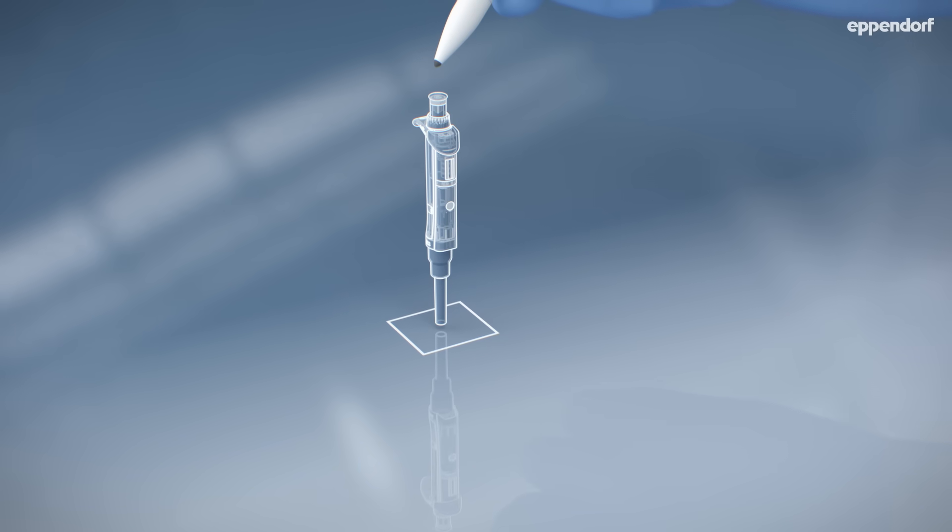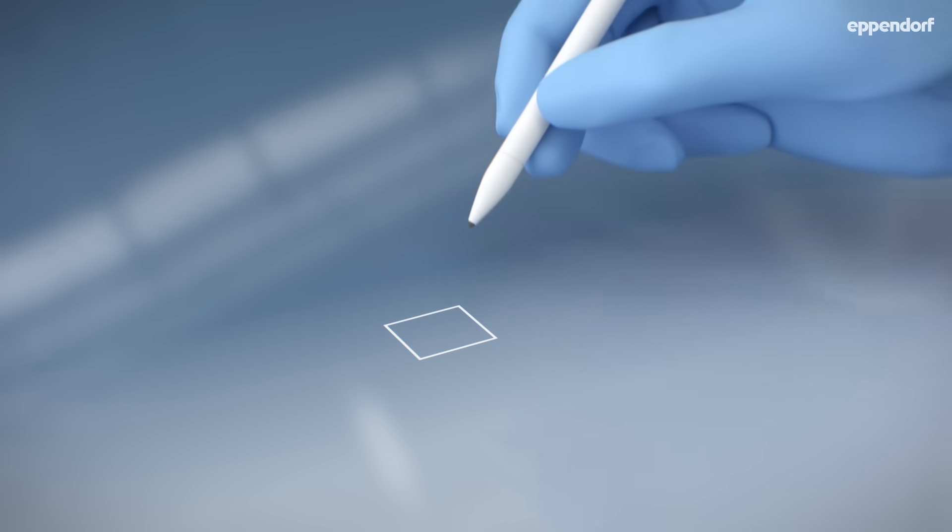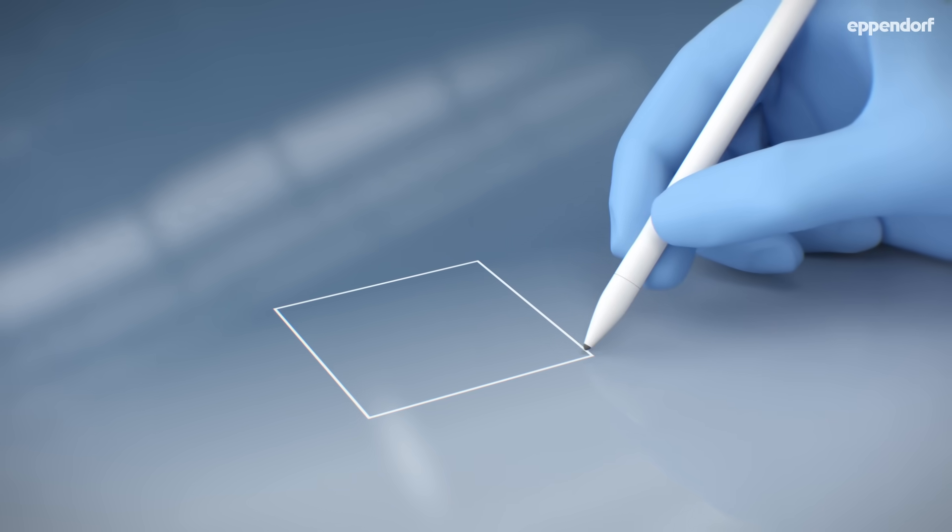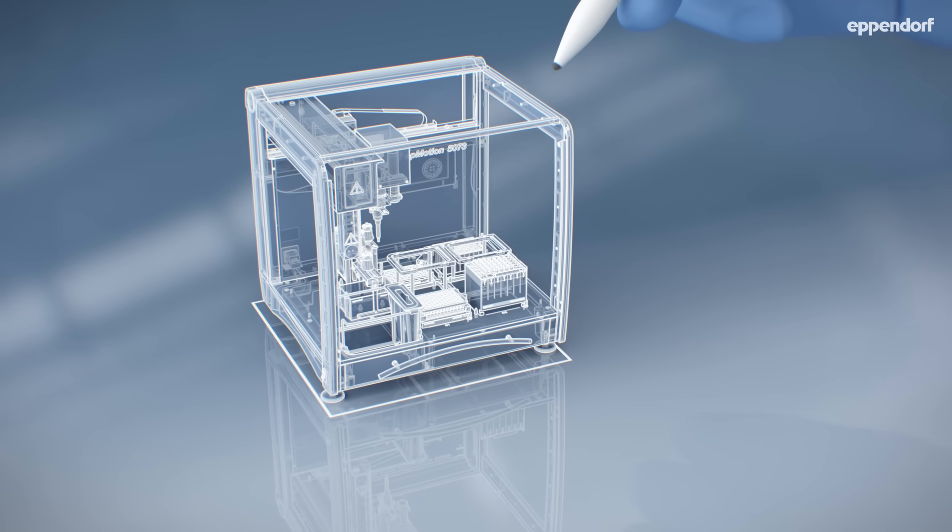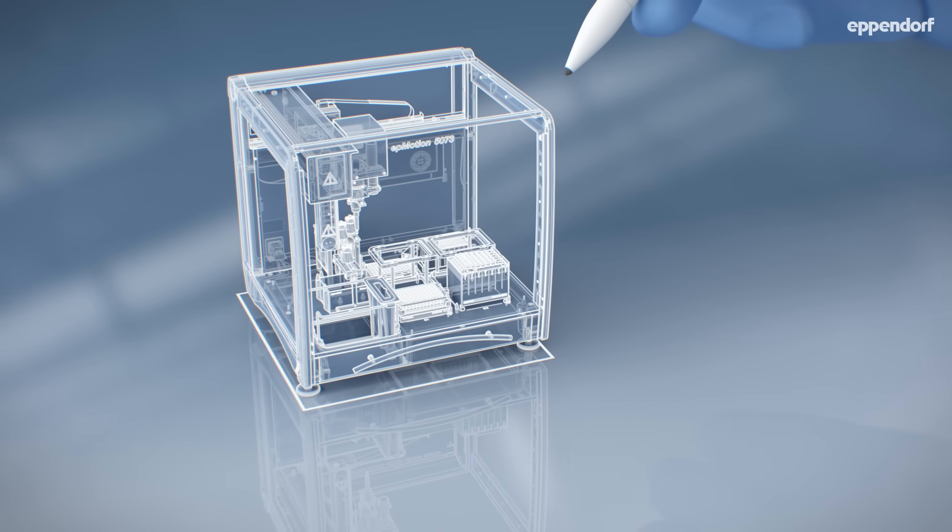Nope, that's too much manual work. Let's get automated here on an EP Motion. Bead cleanups can be tricky if handled manually, so we'll get help from a robot.